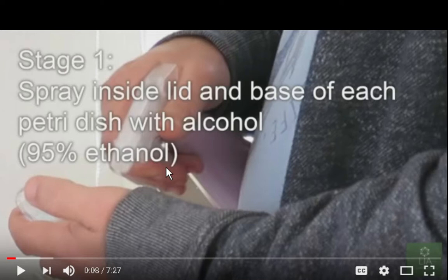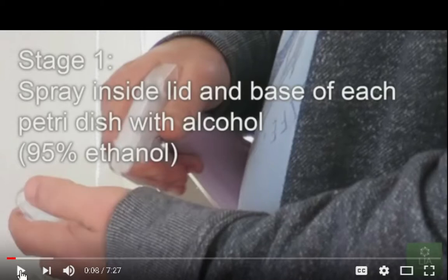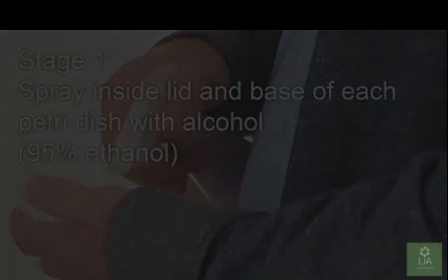I've seen videos where I'll be doing this process inside the closed air container with gloves on, and even my container is going to be wiped down. Everything's going to be a lot more sterile. I'm only using... You can use 91 or 70% or 90.